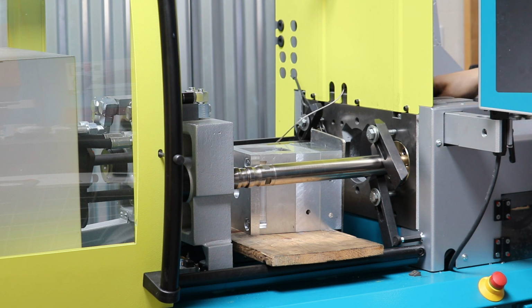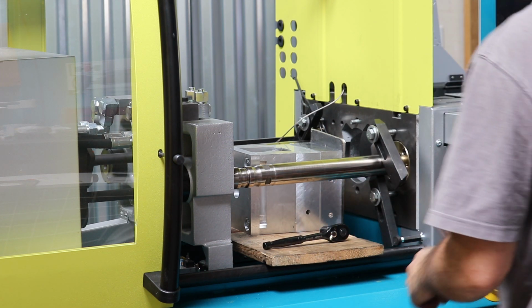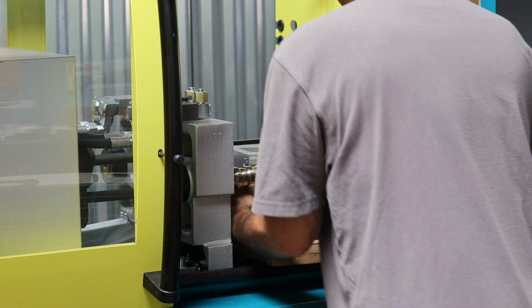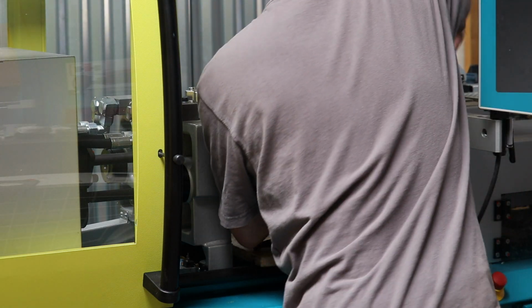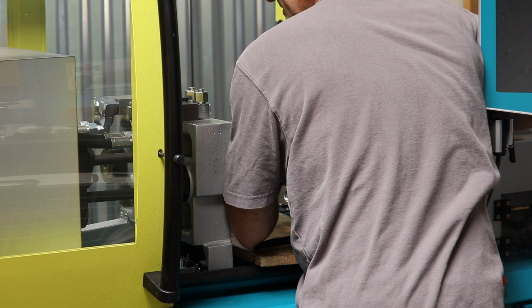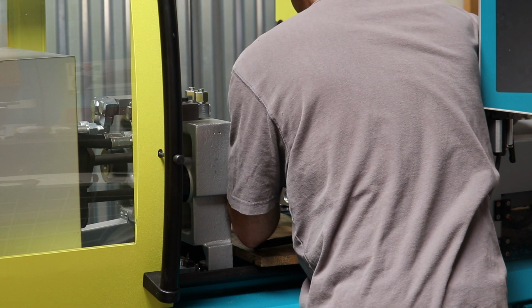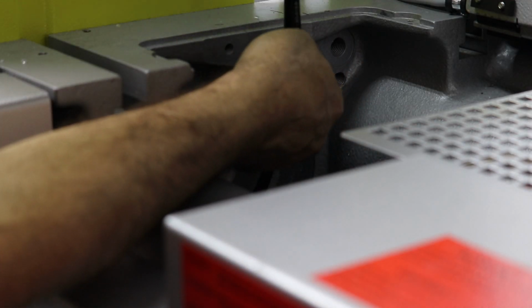I'm going to open this gate up. So this is a little tricky, but basically I've got to hold the mold up and tighten the screw on at the same time. You may not be able to see this part. There we go. So what I'm doing is tightening this screw on while I'm holding the mold up onto the platen side, and it's centering on the reference ring. Okay, so there we go. And basically we're drawing the mold up onto the platen.